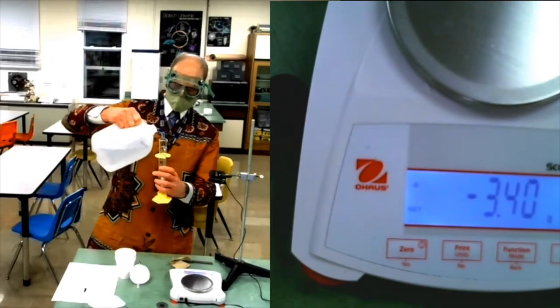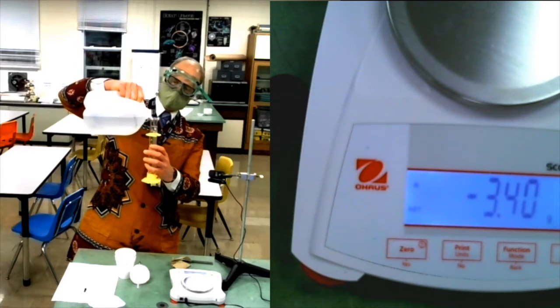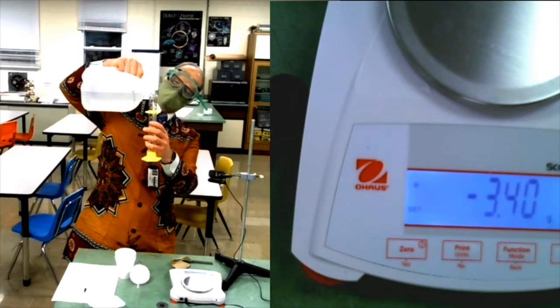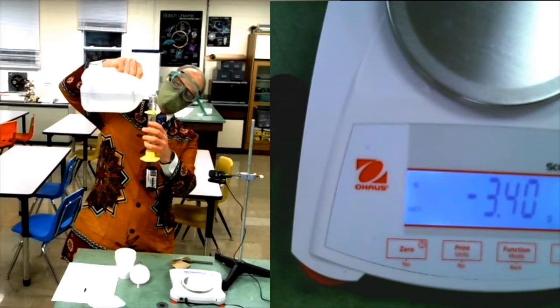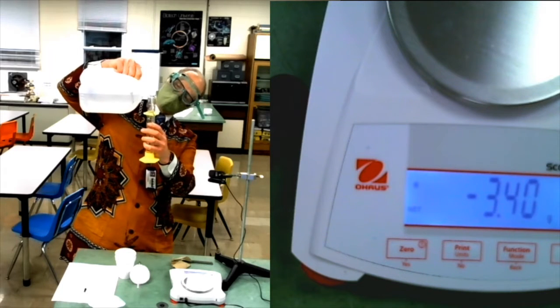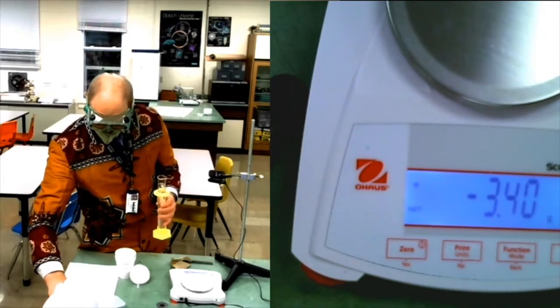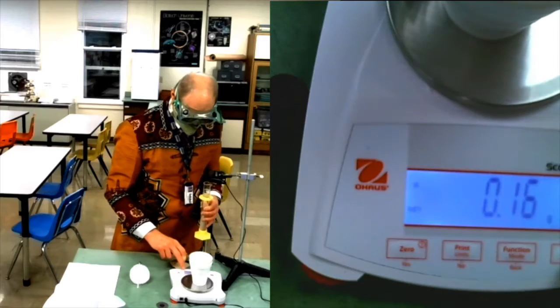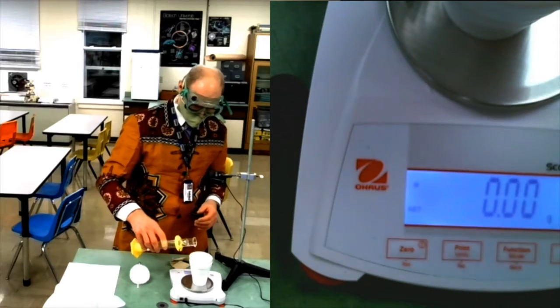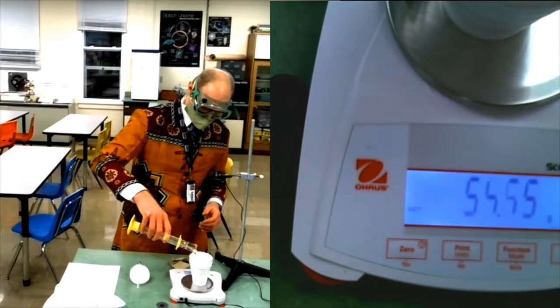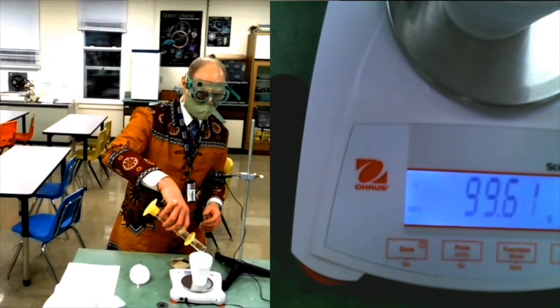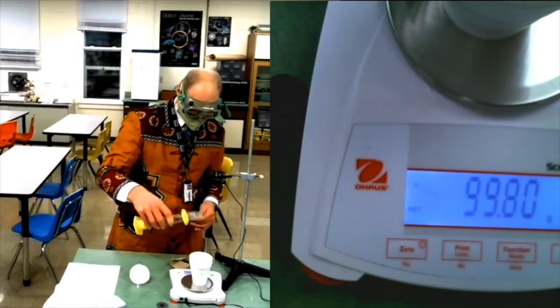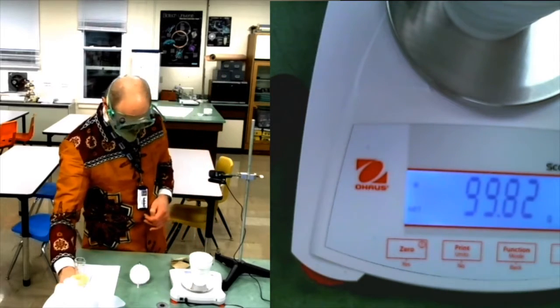Now for the water. This graduated cylinder seems to be going a little low, so I'm going to fill it a little high. Not quite high enough - that's 99.82, pretty close to 100.